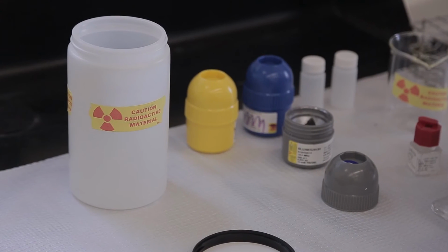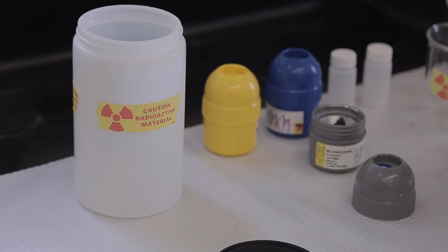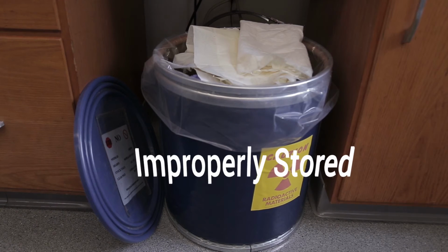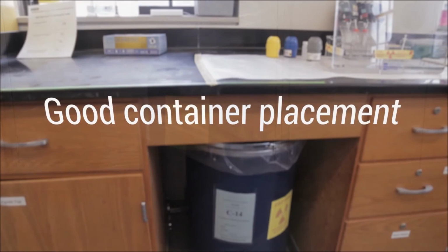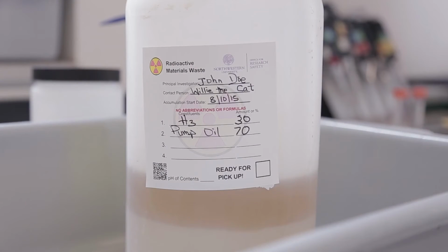Other smaller waste containers may be appropriate for your needs. Contact ORS HPS if you need an alternative size waste container. Waste containers must be properly stored and have a label identifying the contents.